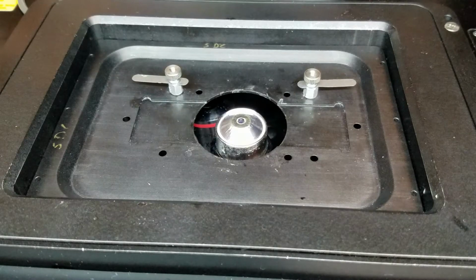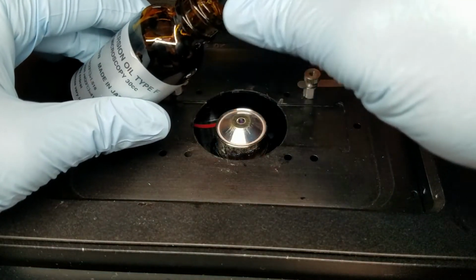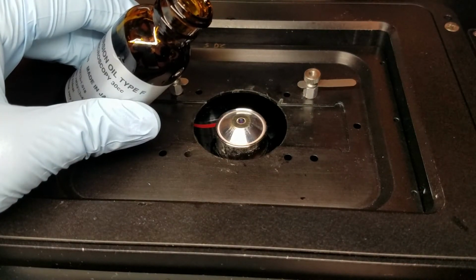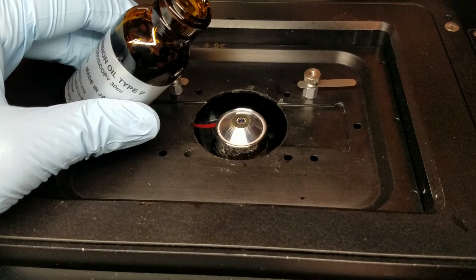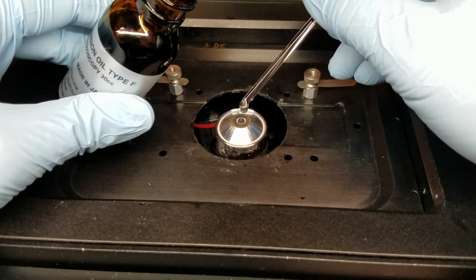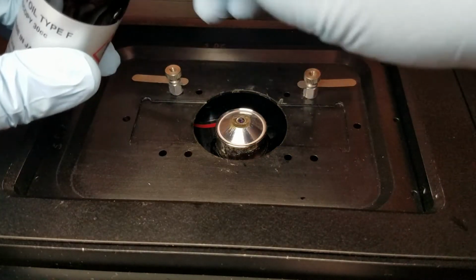Do a full clean. What I'm going to do first, just to illustrate how to clean the objective completely, is I'll put another, hopefully very small drop of oil onto this objective here. Here we are. All right, you can see the drop forming at the bottom. All right, you can lower it down. There it goes, wicking across.